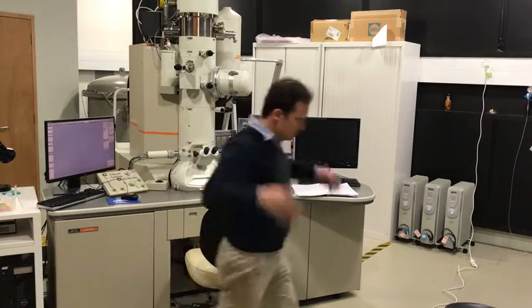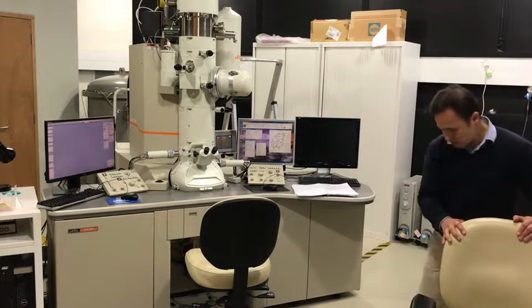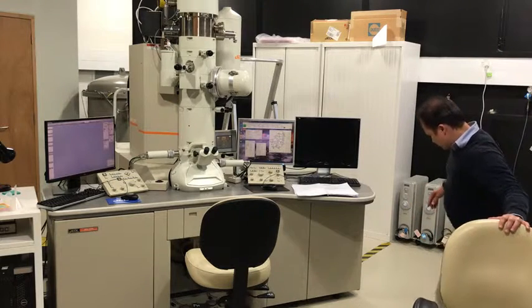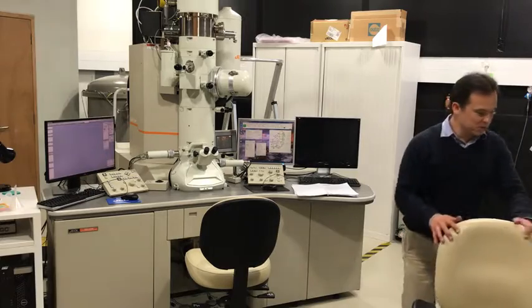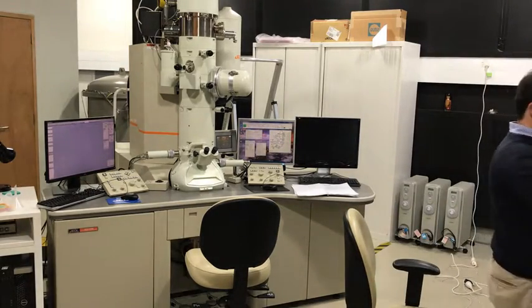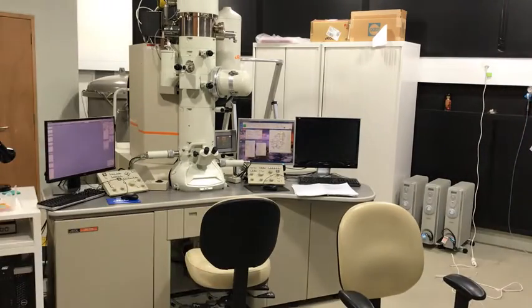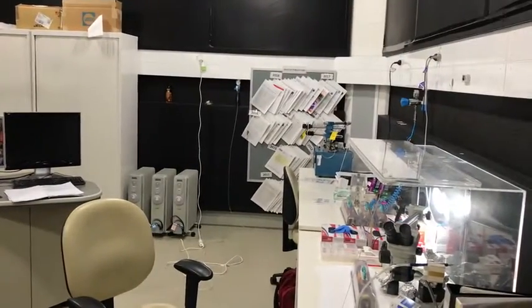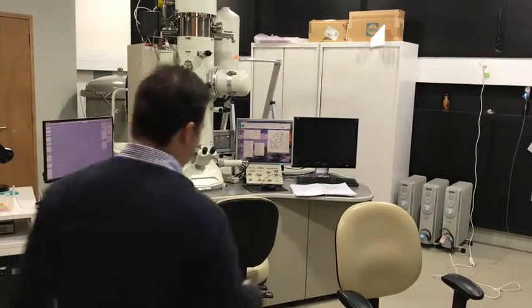So for that I need gloves. And I need to prepare the bench. That's the power cord for keeping my phone juiced up so that I could make this video. Open the hatch. Can you see that? No, you can't. But I just opened that. And now I'll just put on some gloves.